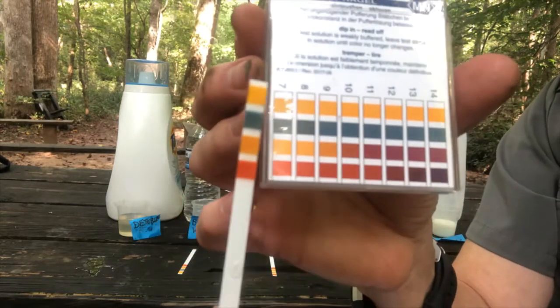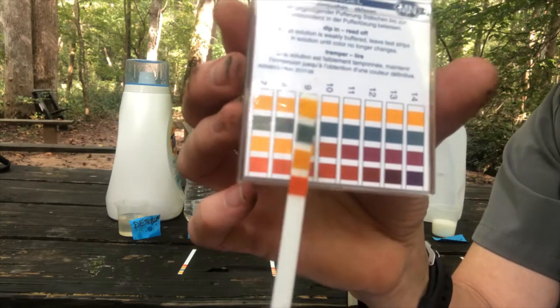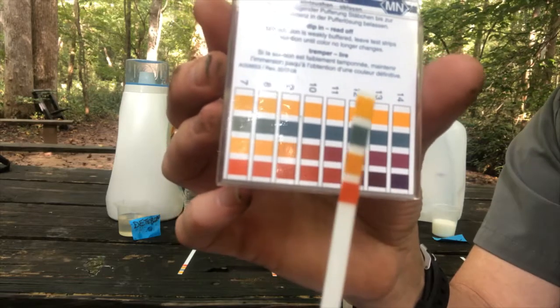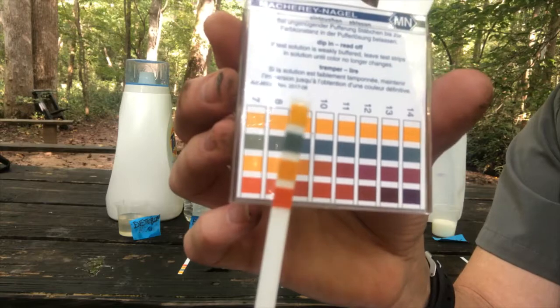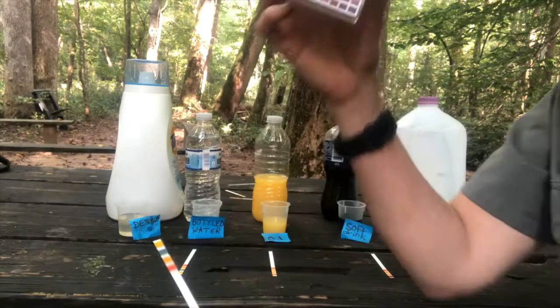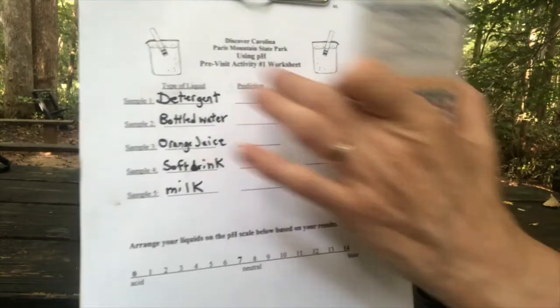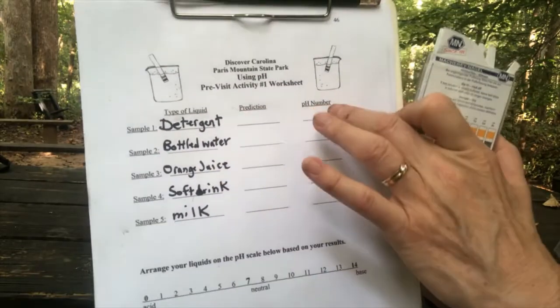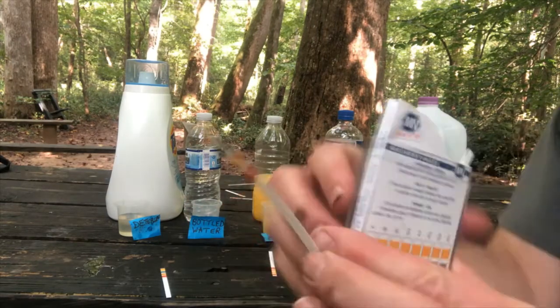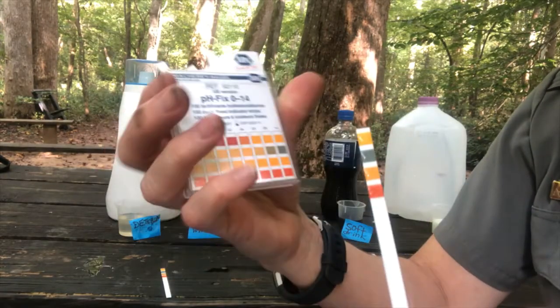7 appears on both sides of the box. And try to determine what it is closest to. Looking at green first, and then look at all 4 of the colors. So you determine that. You're the scientist today, and write that down on your sheet for the 3rd row. Like for sample 1, you had your predicted pH, and write down what it actually was. So now let's look at the bottled water. And we'll look at a pH strip here. Let's see, I said I wanted to start with 0 to 7.